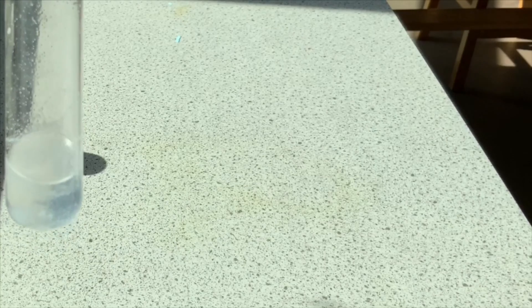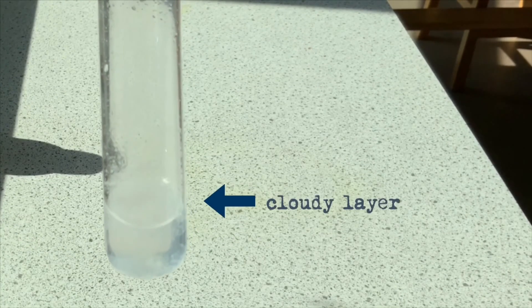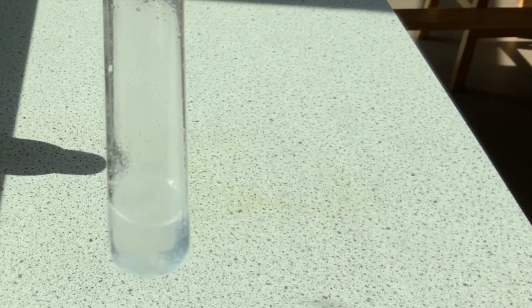...is I should see a cloudy layer forming on the top. It's barely noticeable but it's just about there - there's a cloudy layer.